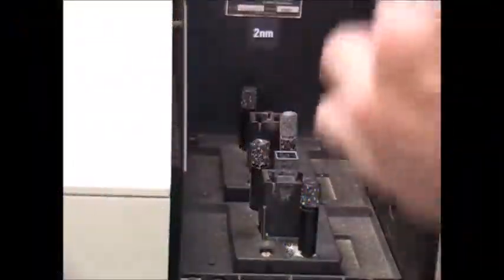Insert the cuvette in the way that the transparent sides are in the east-west direction.